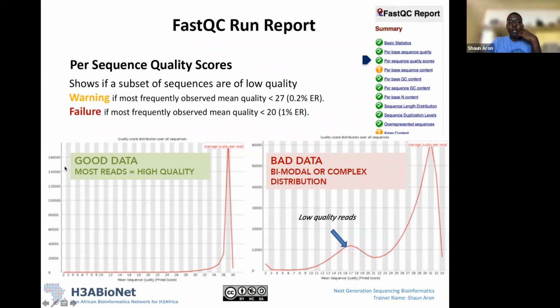So basically here we're saying that this is 160,000. In this particular data set, you'll see that the majority of our reads have a mean sequence quality score of around 34, 35, 36, 37. So the majority of our reads have a mean sequence quality phred score of around 37, 38, and that's essentially a good thing. Remember we said a mean quality score above 30 is a good thing.